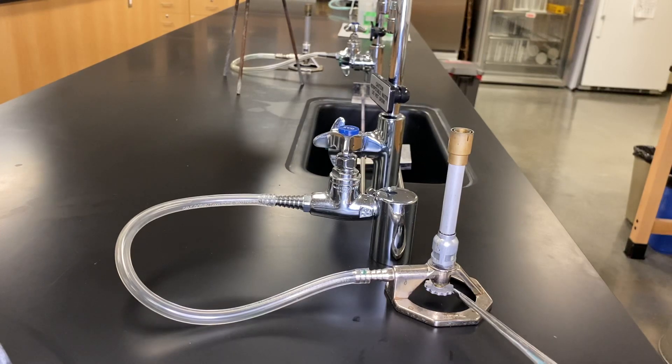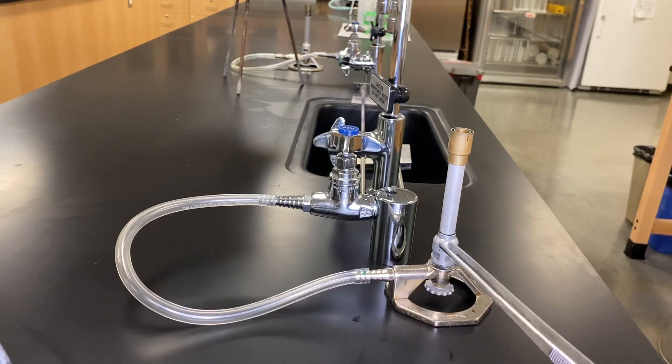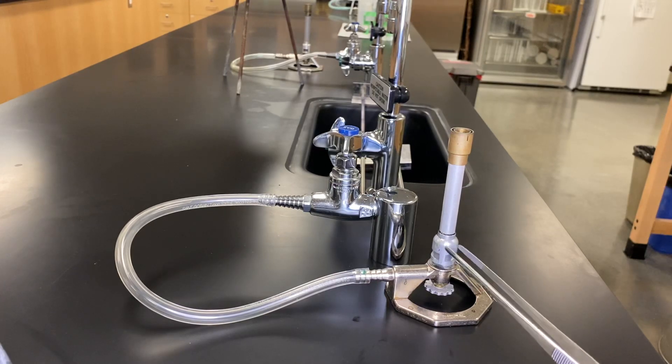So this way, most of the time we won't really adjust it at all. Once it's open, we have it where we want it to be unless the flame itself is out of control. But this guy, this is the guy we're going to be playing with a lot.